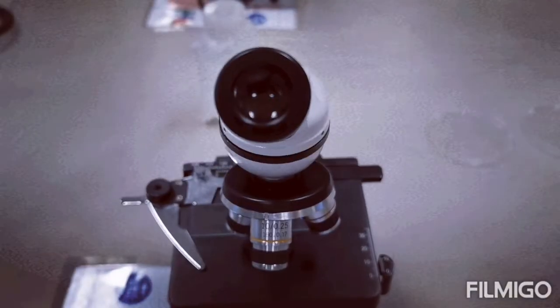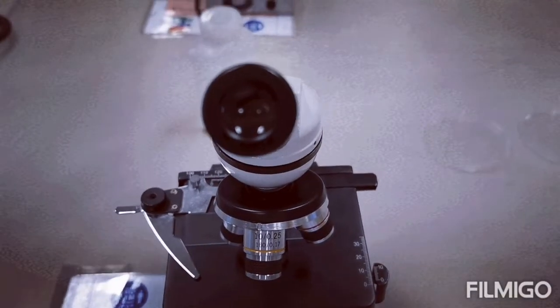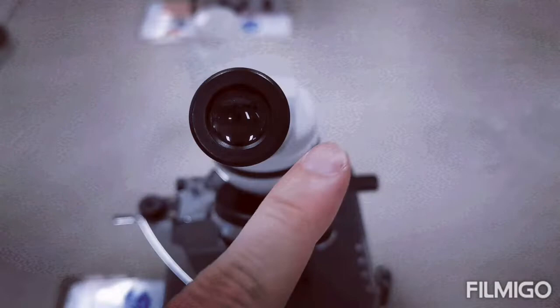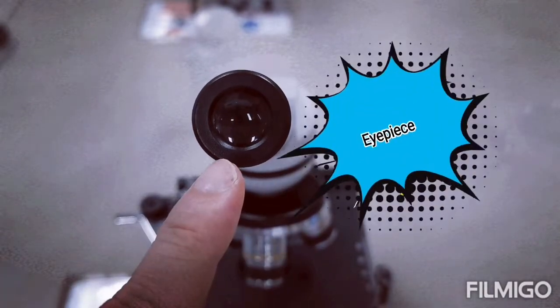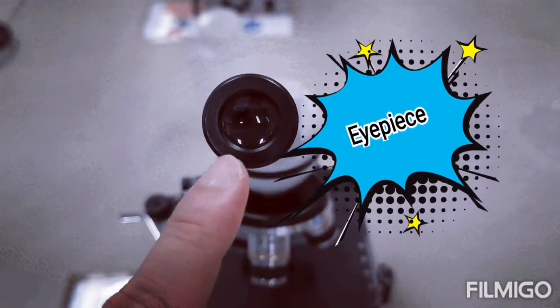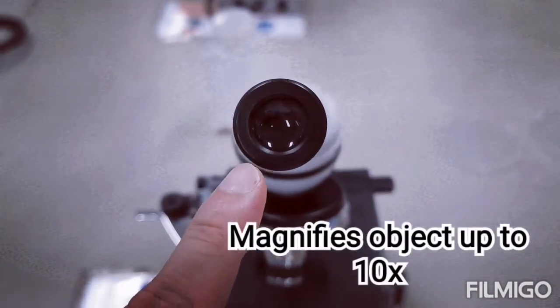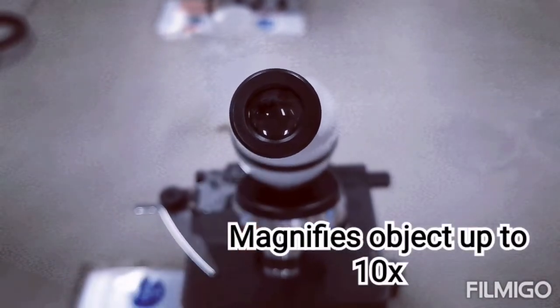We will now recap upon the key parts of a microscope. First up, we have what we call the eyepiece that magnifies the object up to 10 times.